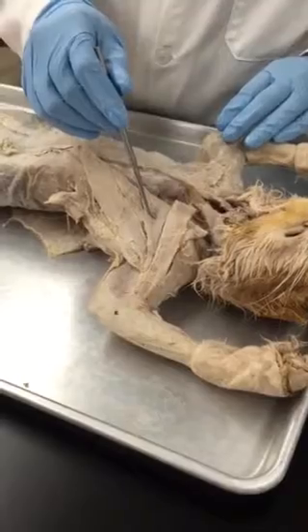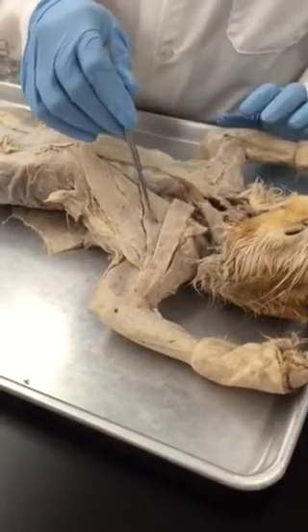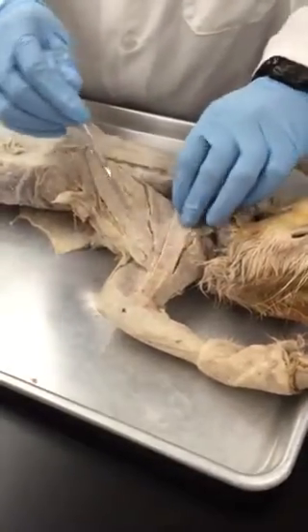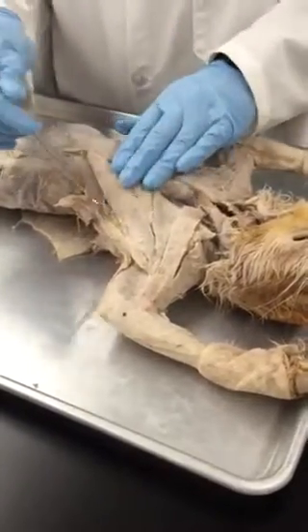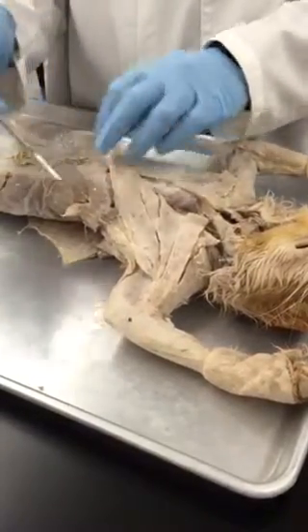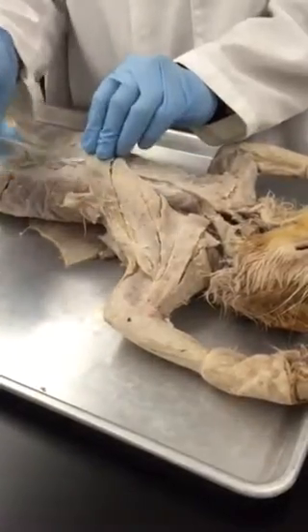Pectoralis major. So you are able to see the superficial side of pectoralis major. These are the deep muscles of pectoralis major, but for the practical, just stick to pectoralis major superficial side. There is pectoralis minor, bigger in surface area. Major, minor, and this is xiphihumeralis.